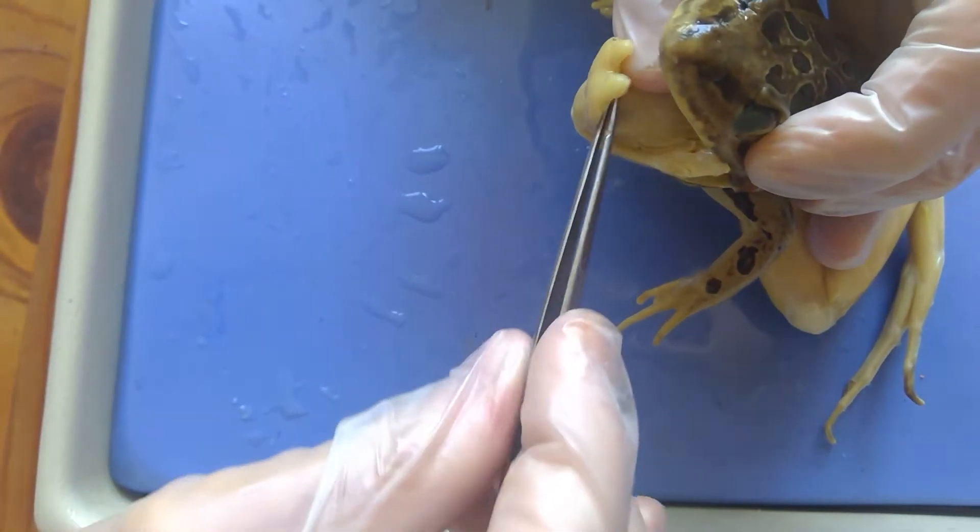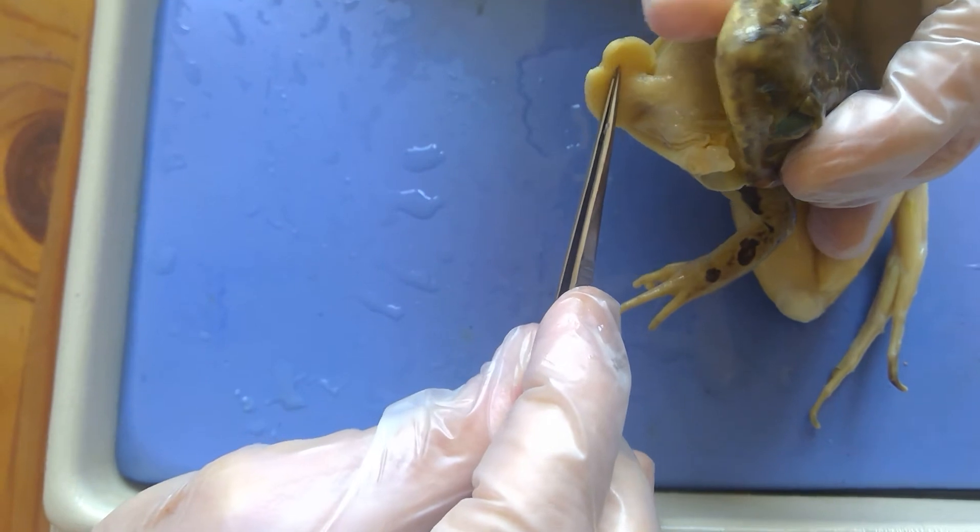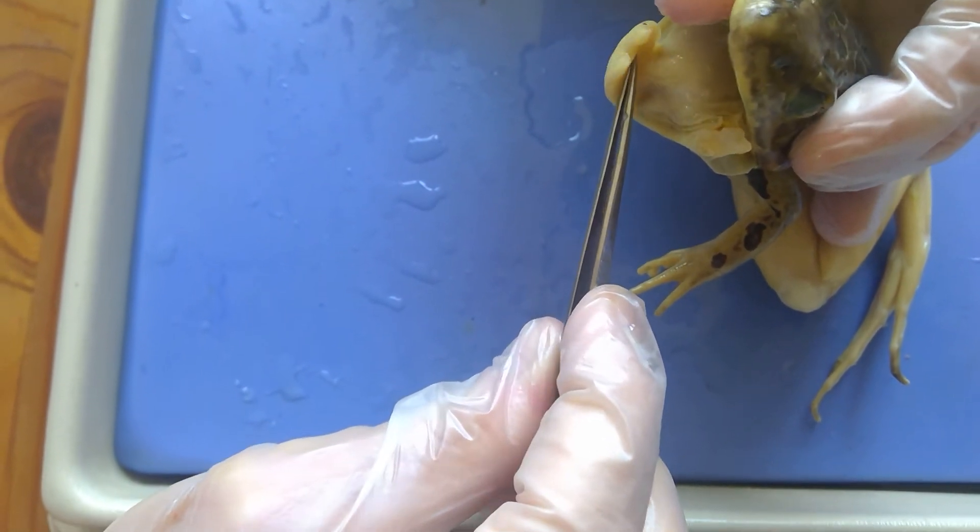This muscle right here can actually extend a lot farther, but again, because it's dead, the muscles are all fully contracted.